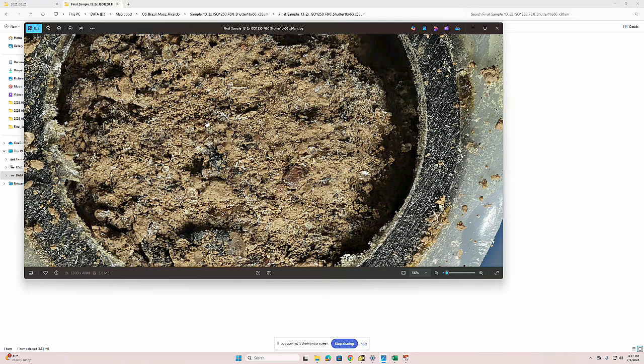No, you need your diffuser if you switch the lenses. It sounds like perhaps you're using the same lighting methods that you used for the 100 millimeter for the MPE 65, and now you need to change those because you're using the 65. There is a diffuser that mounts directly onto the front of the lens for the MPE 65. It's round, it has a blue ring that goes around it. There's a gasket inside of it in order to secure it snugly to the front of the lens. Do you see that?